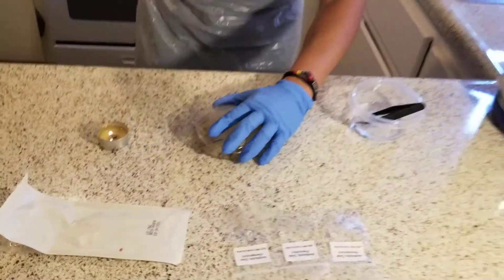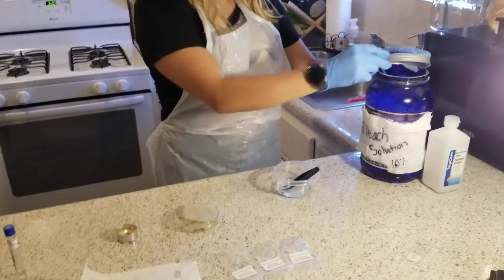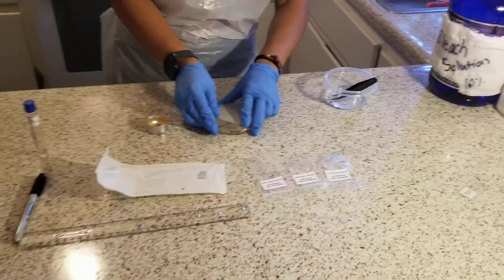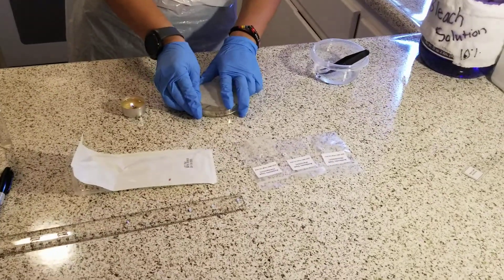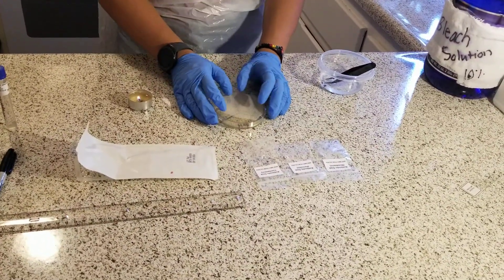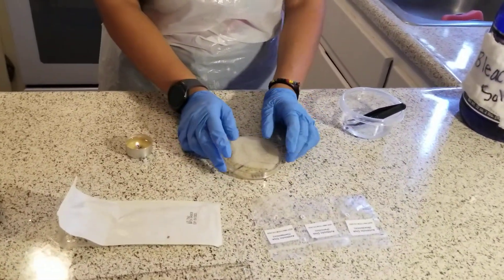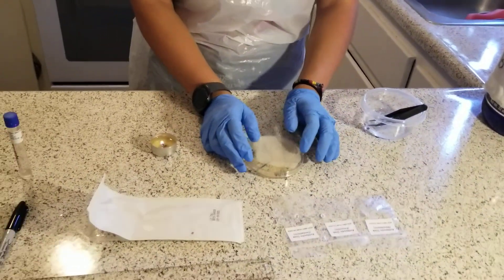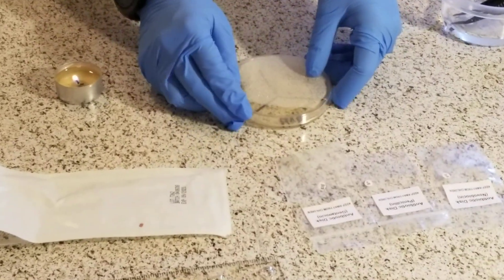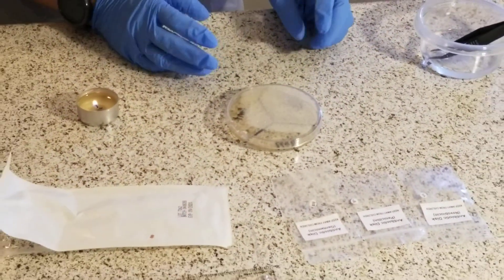Then I will place the spreader in the bleach. I'll allow my agar plate to sit undisturbed with the lid side up for approximately one to two hours until the broth is absorbed by the agar. Then I will be performing the rest of the experiment.